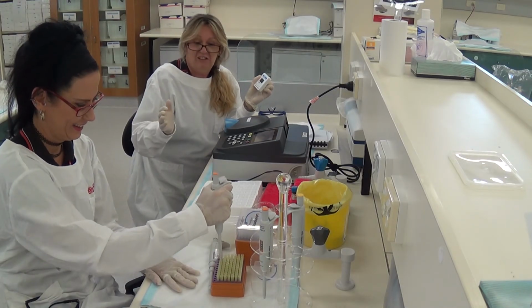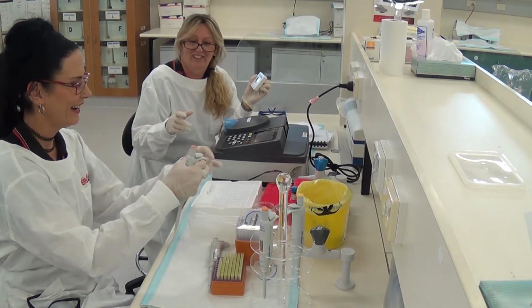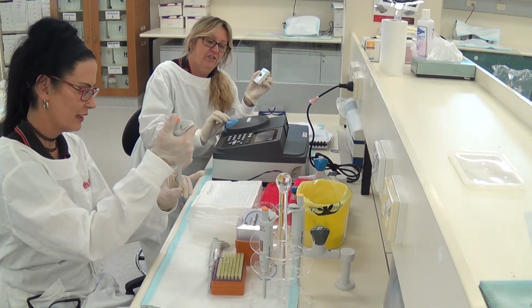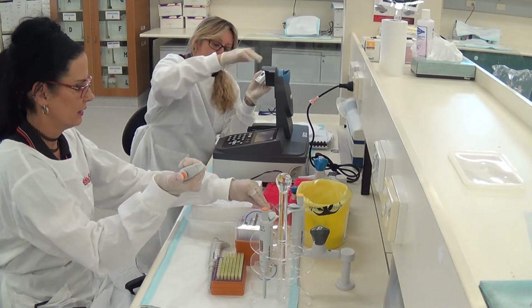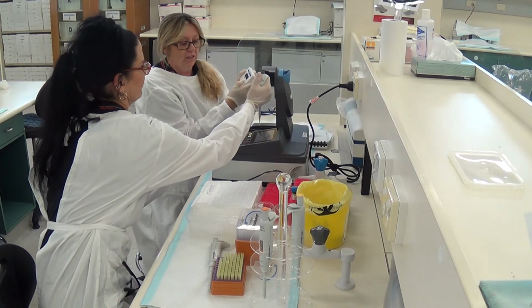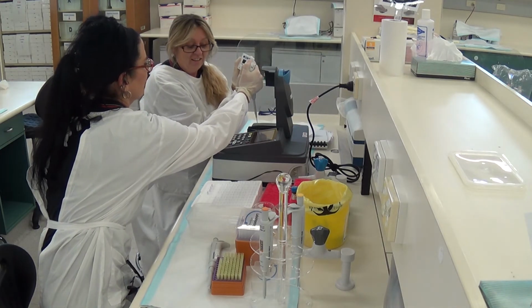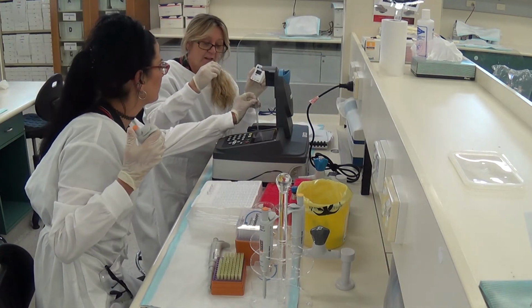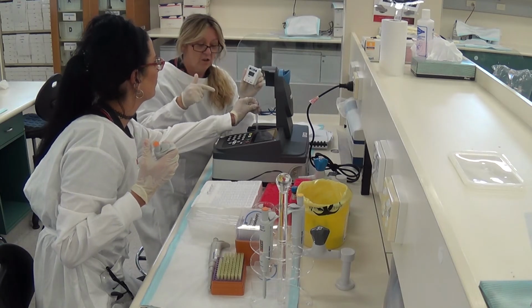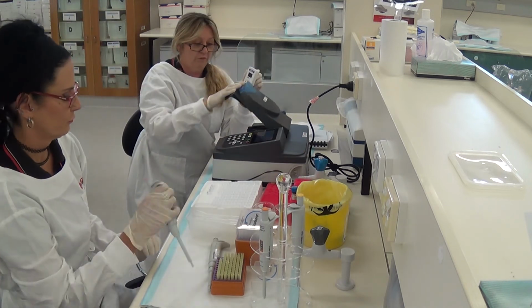Kat is going to put 10 microlitres of our ADH into our number 1 test tube, which we're going to leave in the spec machine. And she's going to say, go. Go. Alrighty. So now we've got 30 seconds in which to make sure that this cuvette is mixed, because we want to make sure that our enzyme and our alcohol and our NAD is all mixed up together before we take our first reading.